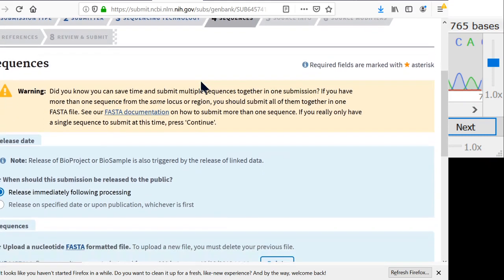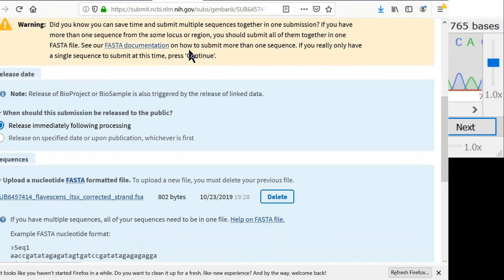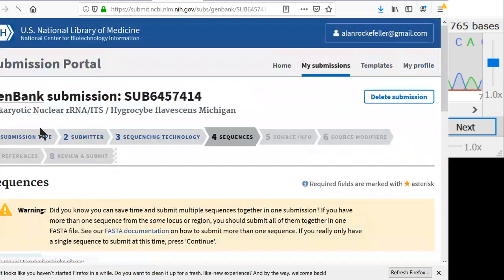But here it just gave me a warning saying you're only submitting one sequence at a time. If you're going to submit a whole lot of sequences, you can put a whole bunch in the FASTA and do a whole bunch. But for this demonstration, we're just submitting one sequence, so that's fine. So I'll just hit continue here.